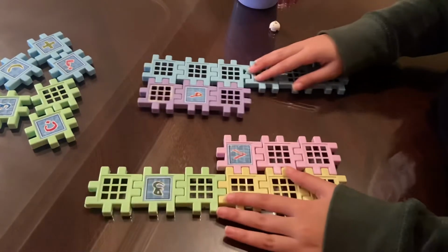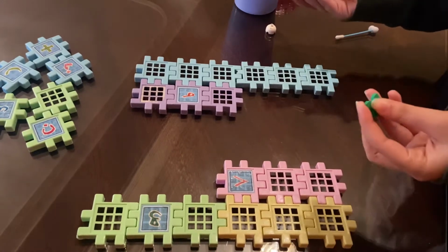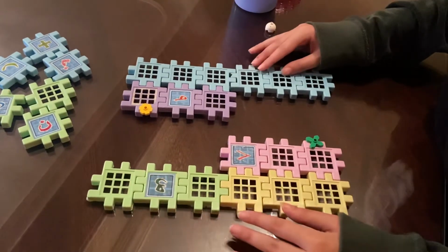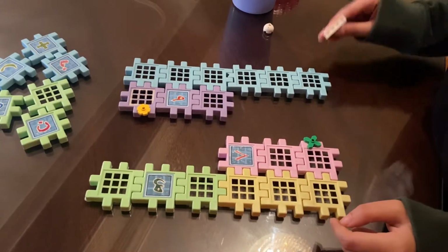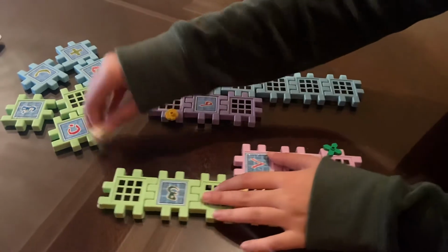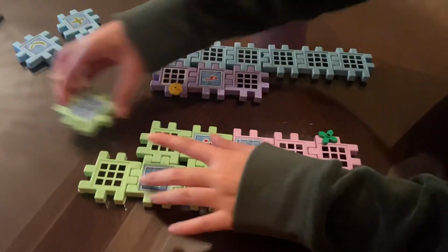Okay, and then there are DNA primers with probes on them, and these light up, allowing the DNA to be read. These represent the probes. So then lastly is the extension process, where the sample is reheated, allowing Taq polymerase to attach to the primers, and it grabs the free nucleotides, making this new DNA strand.